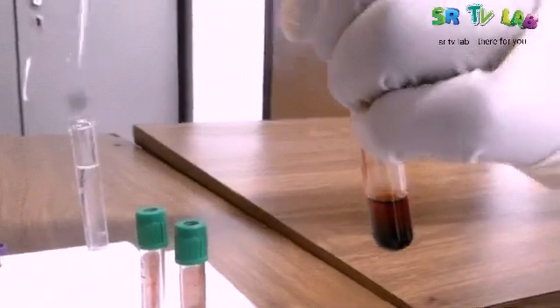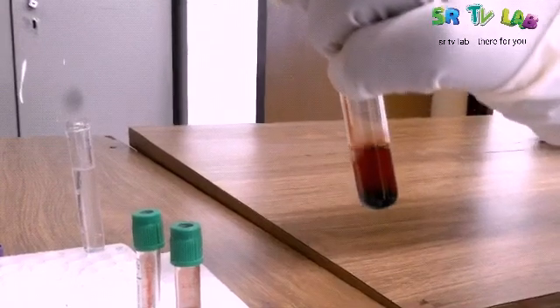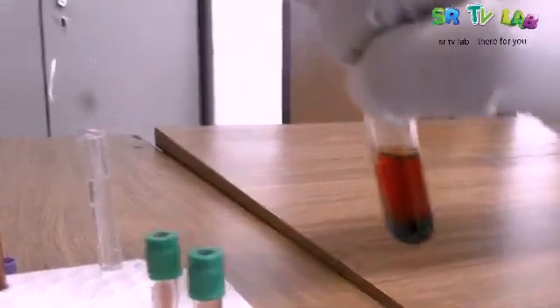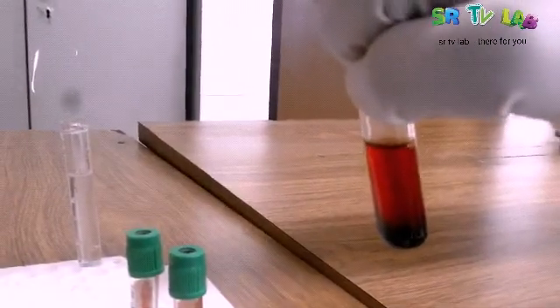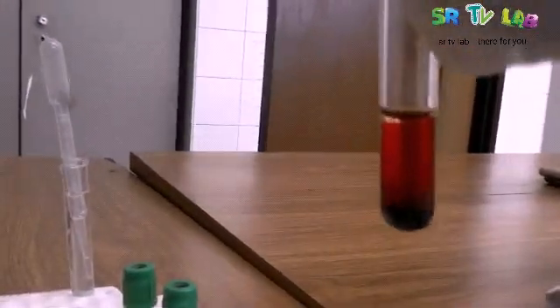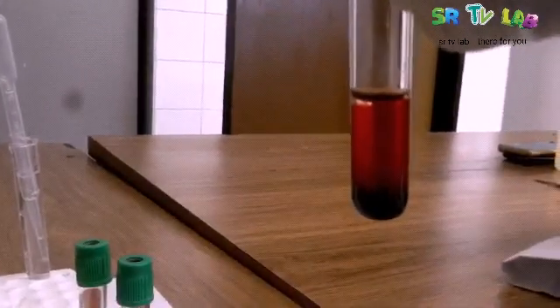The red blood cells — the color has been dense and now it's going to be translucent, more transparent. You see it has already started. The upper part is not as dense as the bottom part. So we are going to shake to see if the color is going to change.